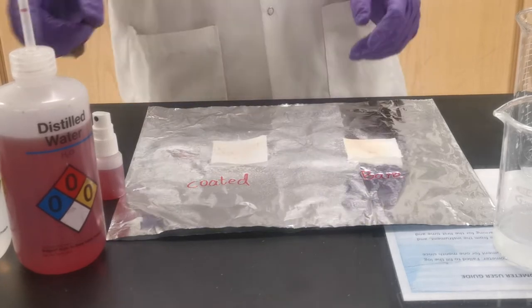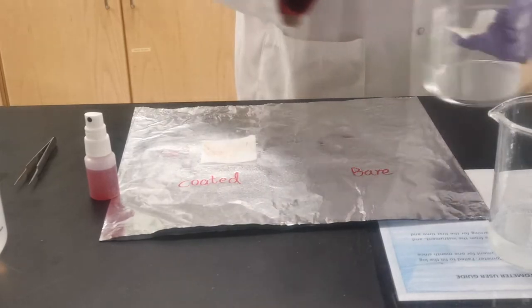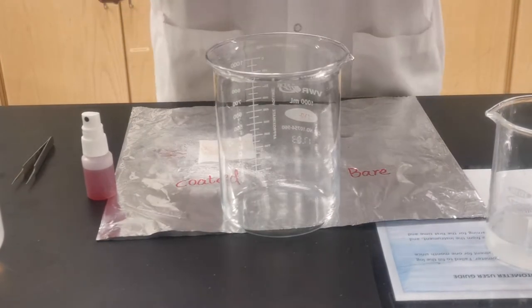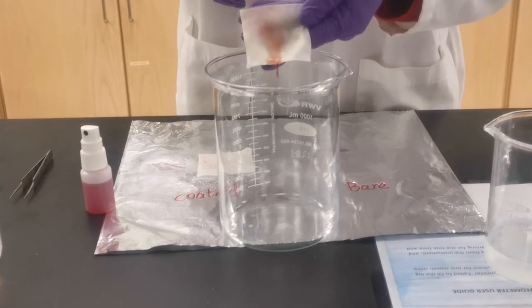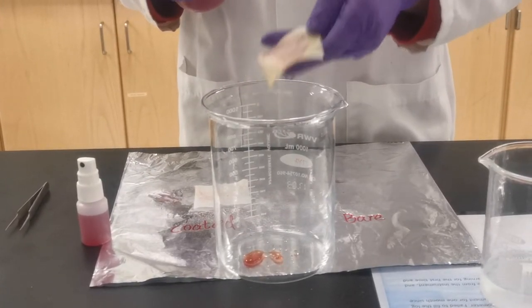To compare, we use the wash bottle. We can see here we have a beaker. When we push the wash bottle on the bare fiber, it is fully dirtied.